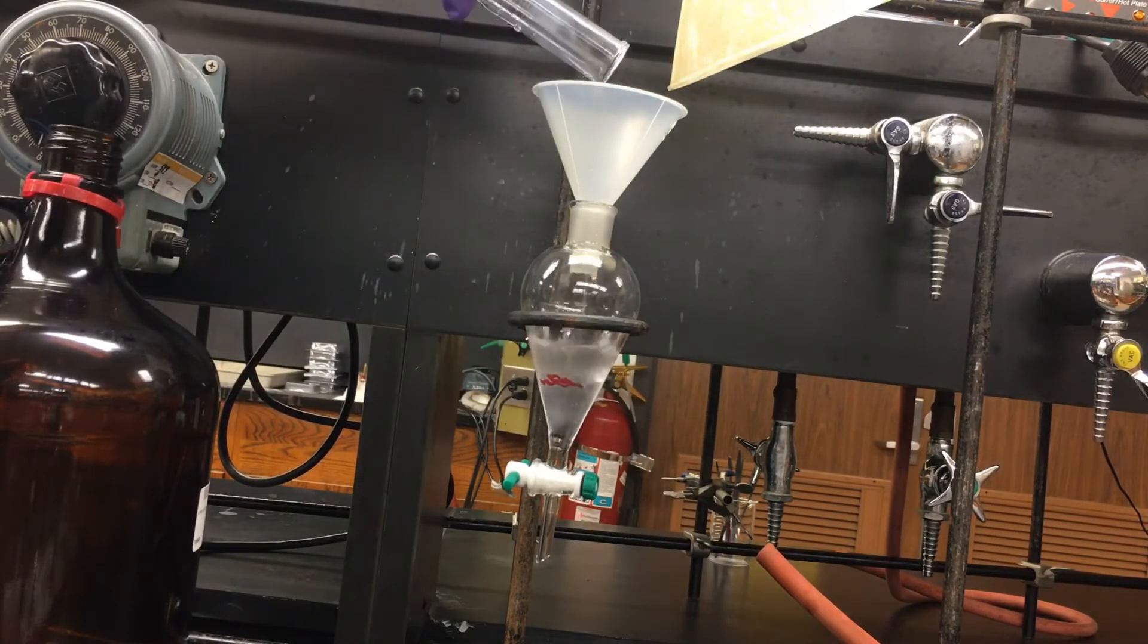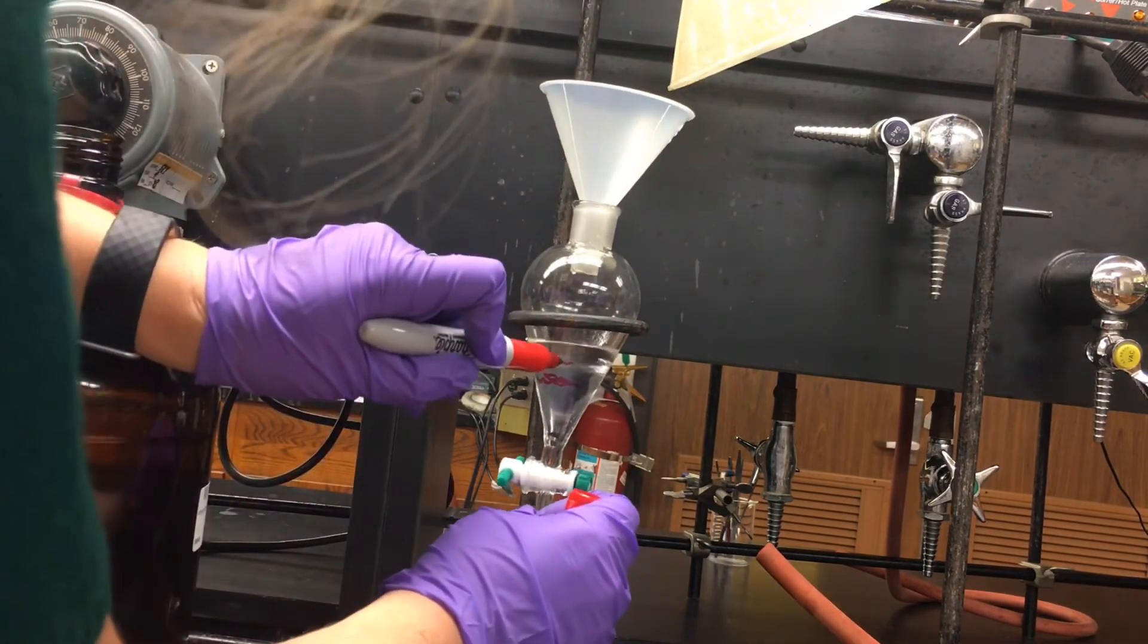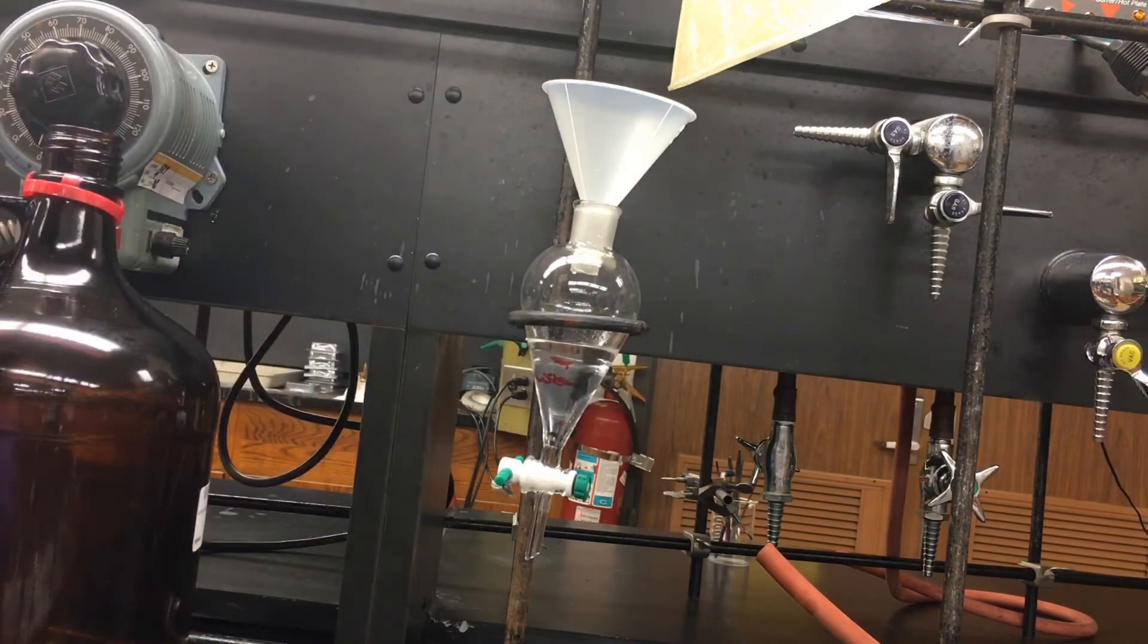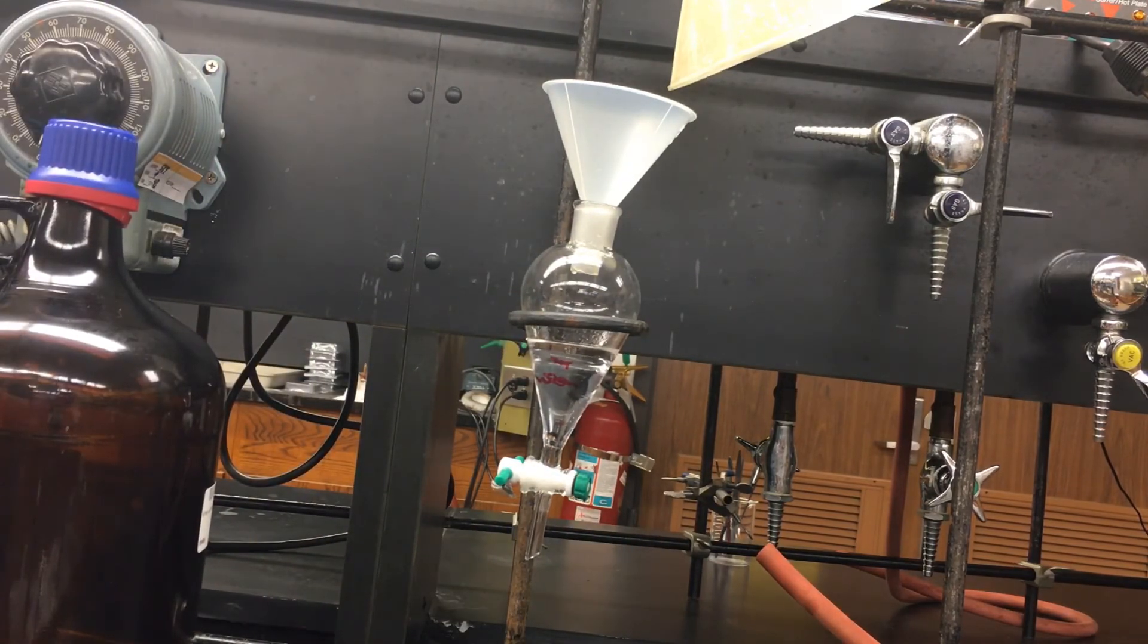10 mils of additional water are being added and we can see now that the interface is much higher. This means that the bottom layer has become larger with the addition of water.